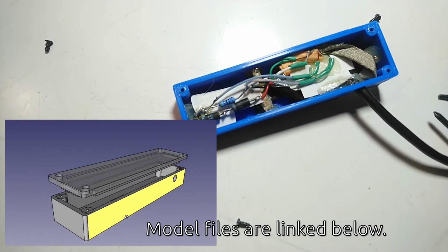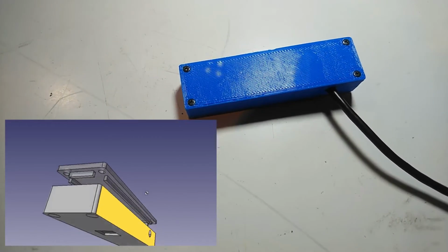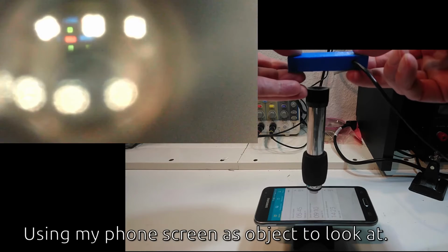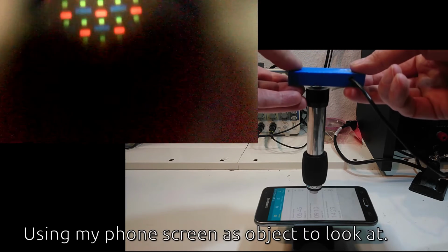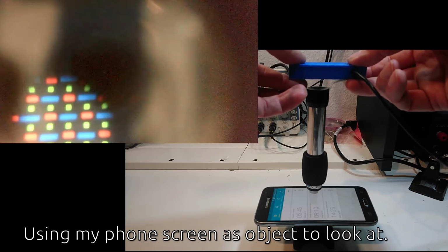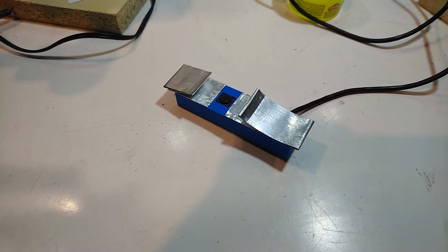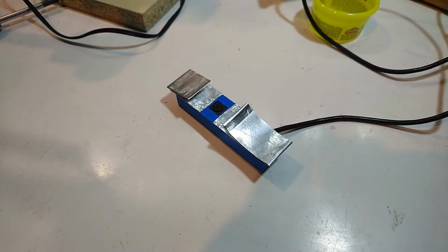My camera module gets an enclosure that is designed in FreeCAD and then 3D printed. A test shows me that the camera will work with the microscope, and where I have to place it. These camera modules can get quite warm, by the way, and PLA plastic doesn't like heat. I added these foil heat spreaders here to even out the temperature a bit.